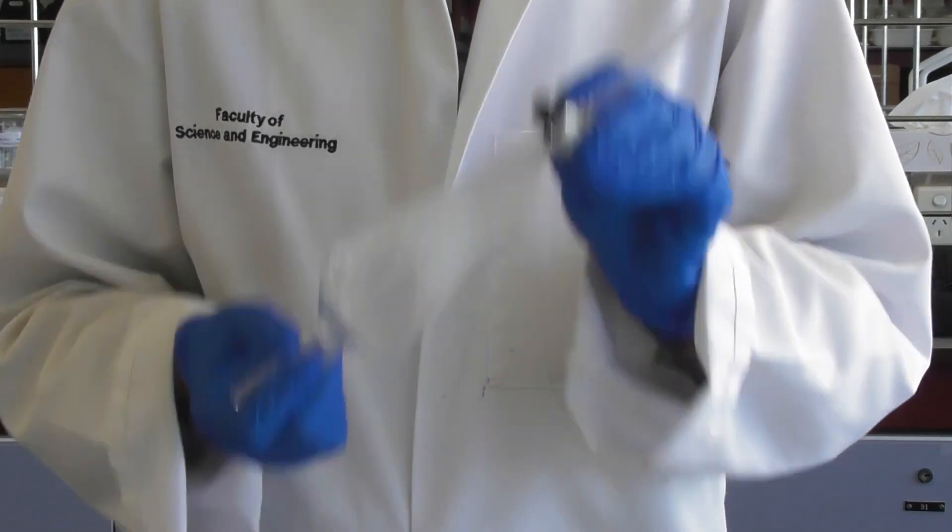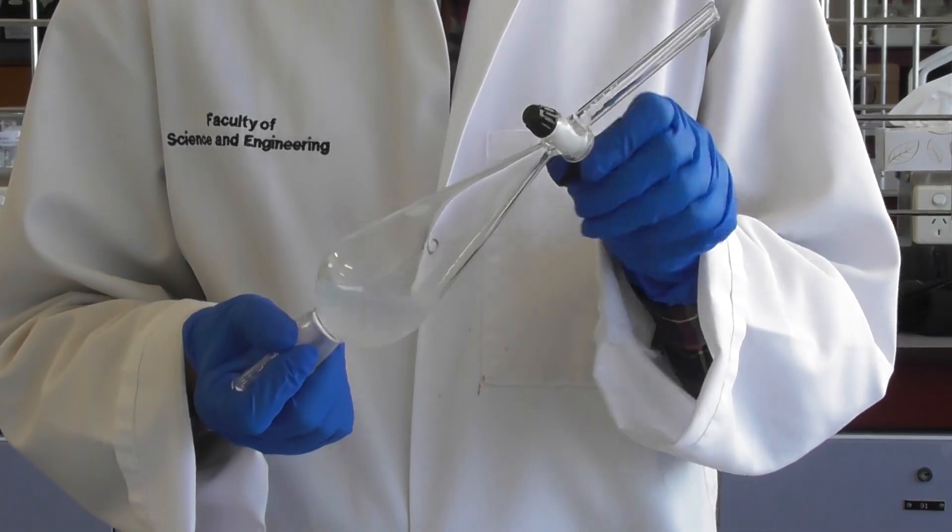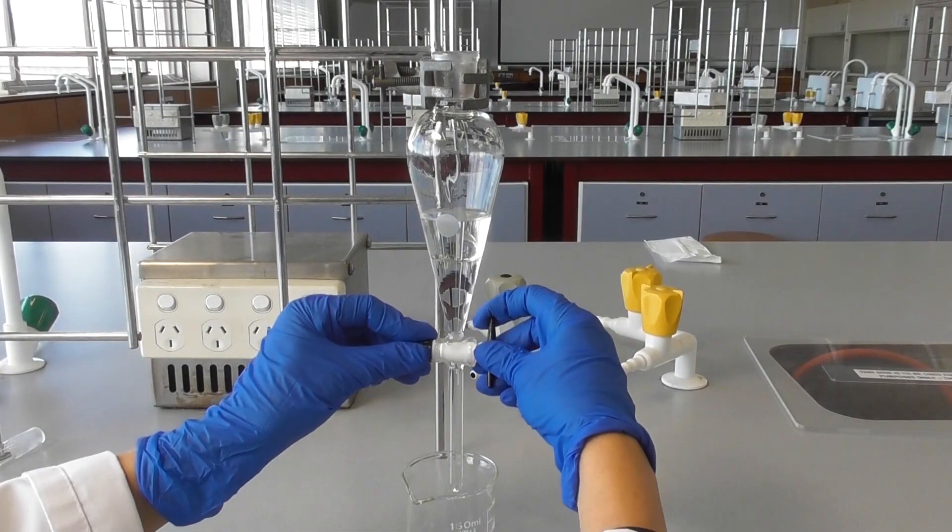Some gas may still develop, so open the tap to release the pressure. Drain the bottom layer.